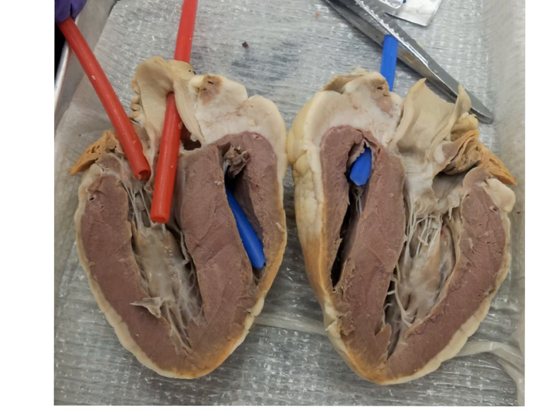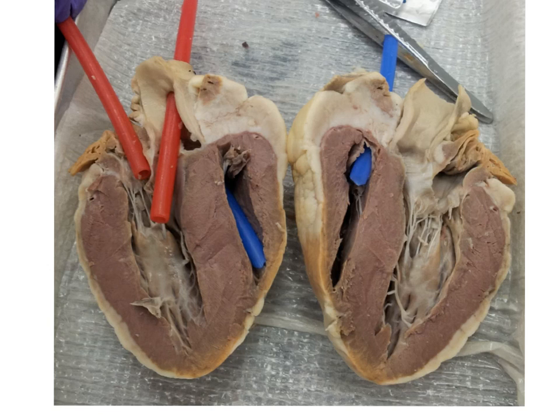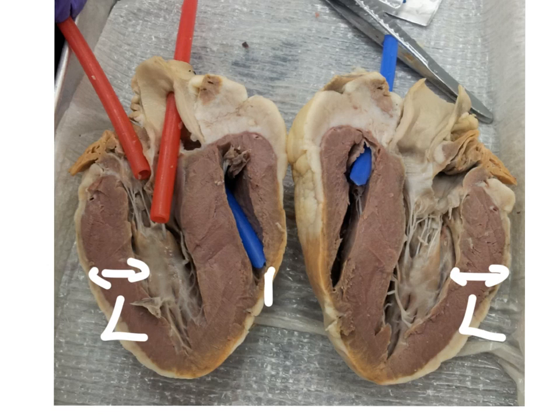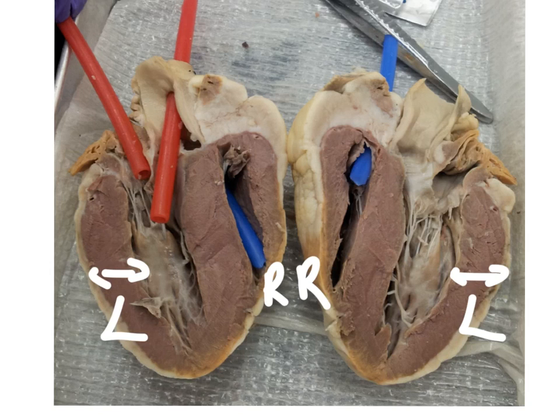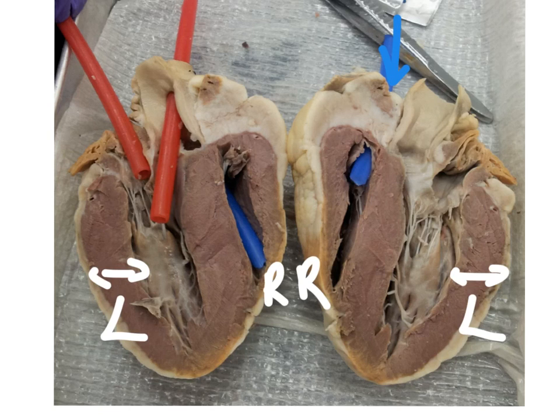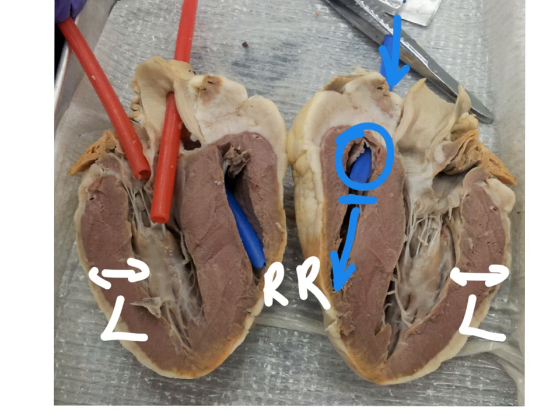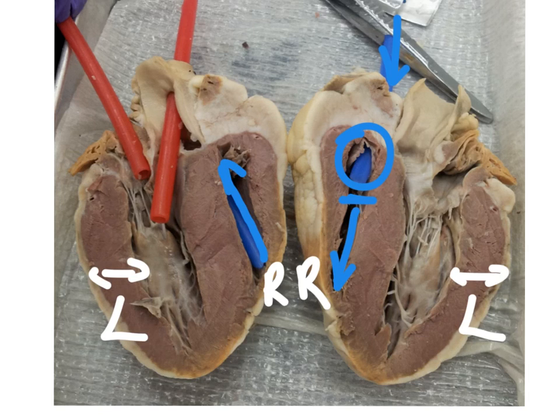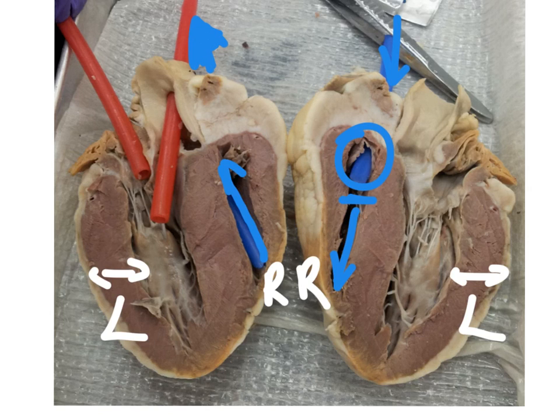Here is the frontal section that's been flipped open. It gets a little complicated, so the best way to identify which is which side is to find the side with the thicker myocardium — that is always going to be the left, and the thinner side will be the right. These two dissections are actually opposite to one another. So let's follow the path of blood: we would have the superior vena cava coming into the right atrium, going through the tricuspid valve into the right ventricle, then going up and out the pulmonary trunk leading to the pulmonary arteries.